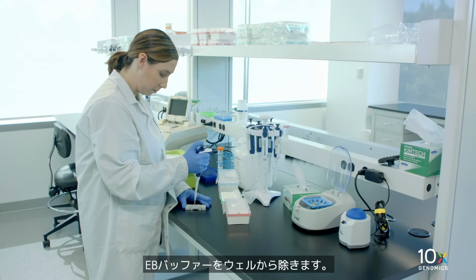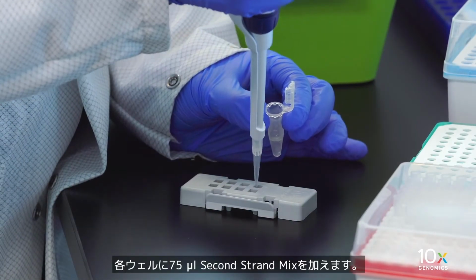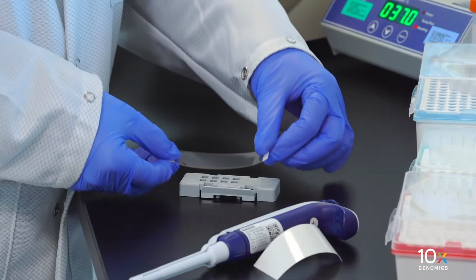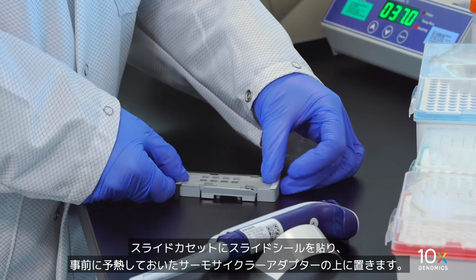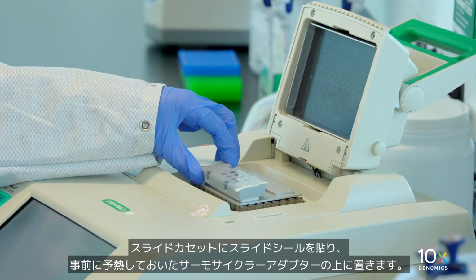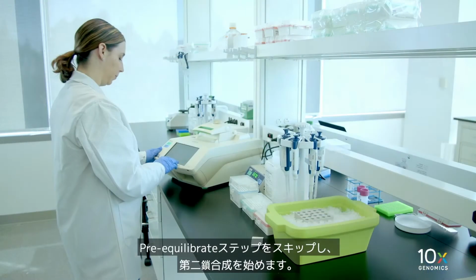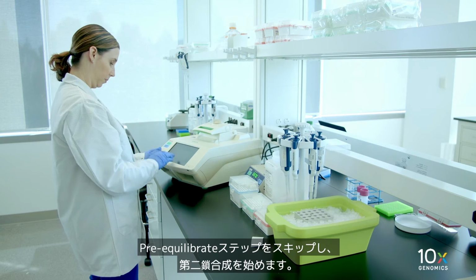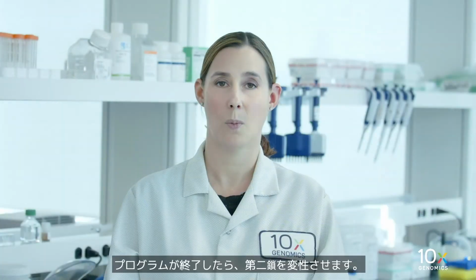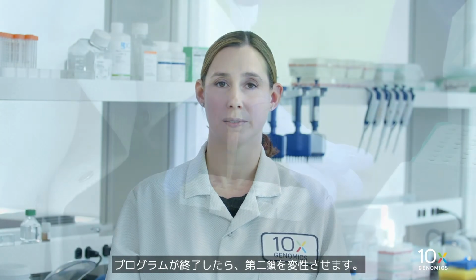Remove buffer EB from the wells. Add 75 microliters second strand mix to each well. Apply slide seal on the slide cassette and place on the thermocycler adapter on the preheated thermocycler. Skip the pre-equilibrate step to initiate second strand synthesis. When the program is done, we will denature the second cDNA strand.